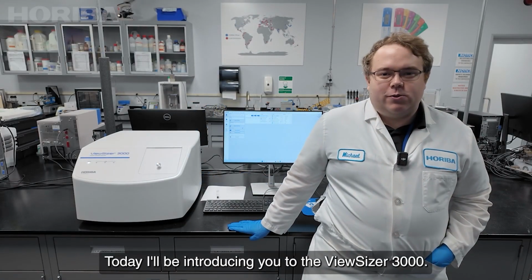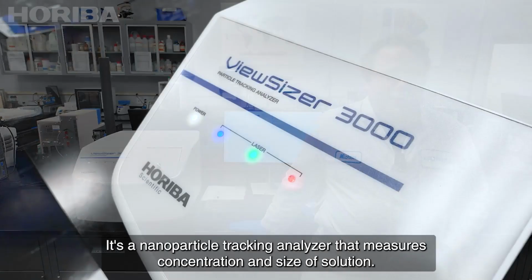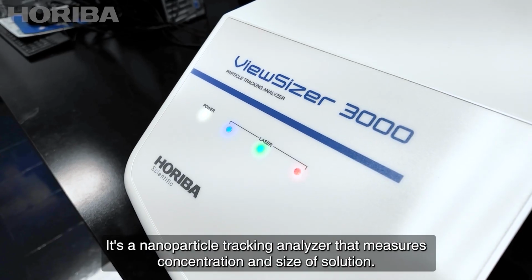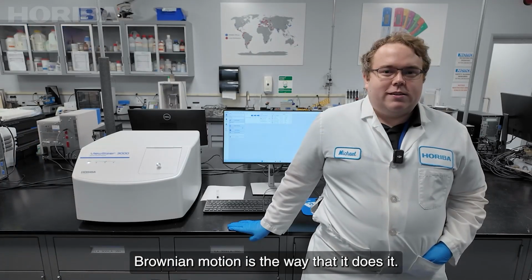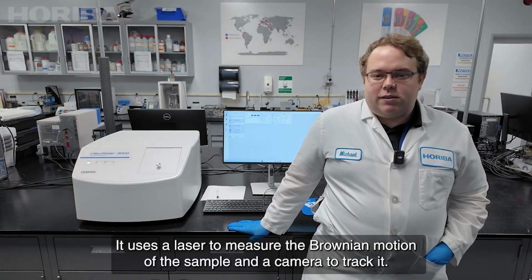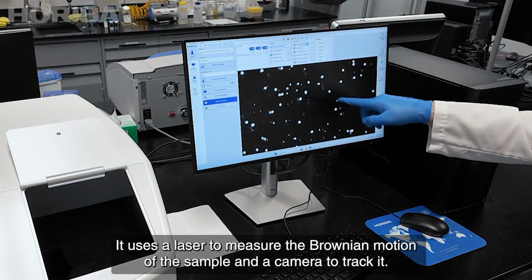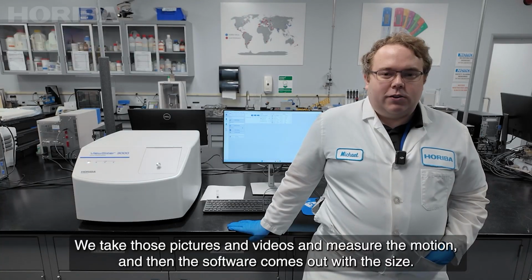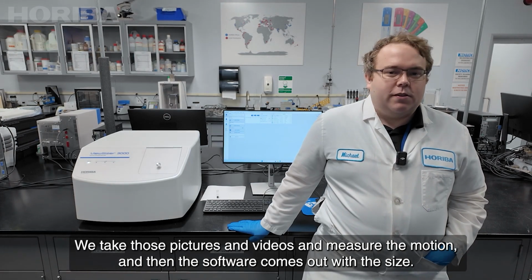Today I'll be introducing you to the ViewSizer 3000. It's a nanoparticle tracking analyzer that measures concentration and size of solution. Brownian motion is the way that it does it. It uses a laser to measure the Brownian motion of the sample and a camera to track it. We take those pictures and videos and measure the motion, and then the software comes out with the size.